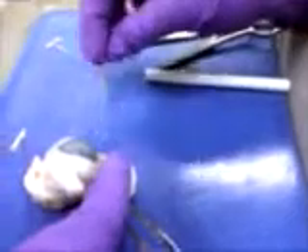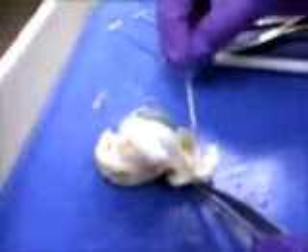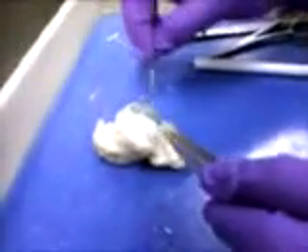Cornea. So if this is the cornea, how do they open and close their eyes? This is open and close eyes — this is the sclera. So cornea. So this is the retina. Choroid and then the retina. But choroid is black. So this is the choroid. Sclera.